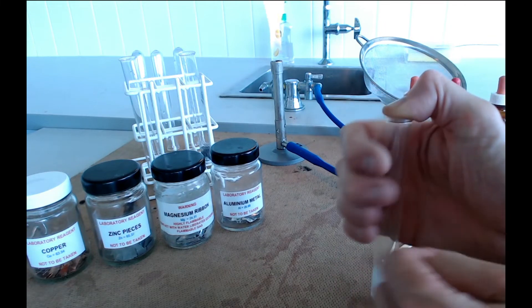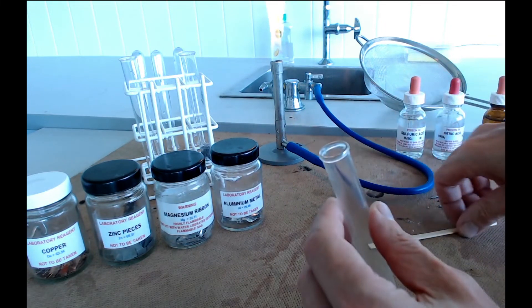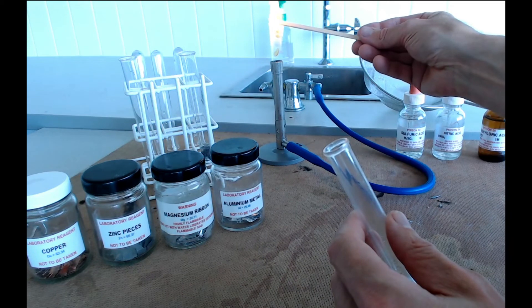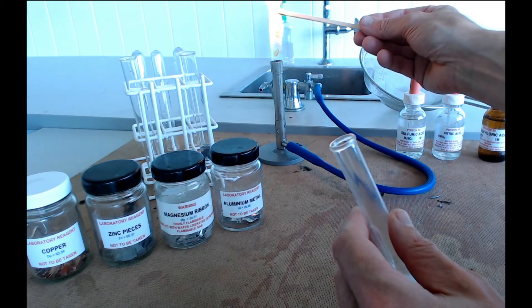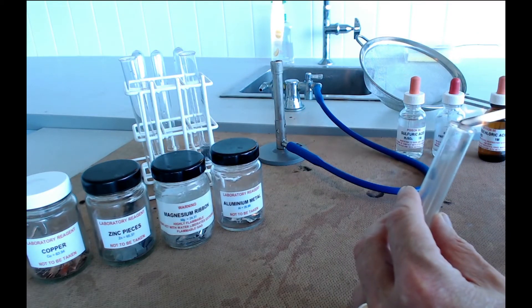Testing it is a matter of getting your wooden splint, lighting it in the Bunsen flame. So that's why this Bunsen flame has been sitting here burning for a while. And then lighting the gas in your test tube.